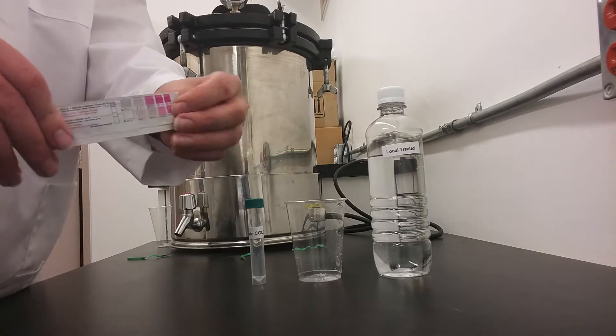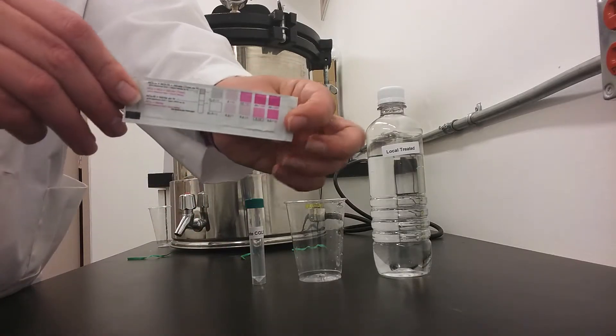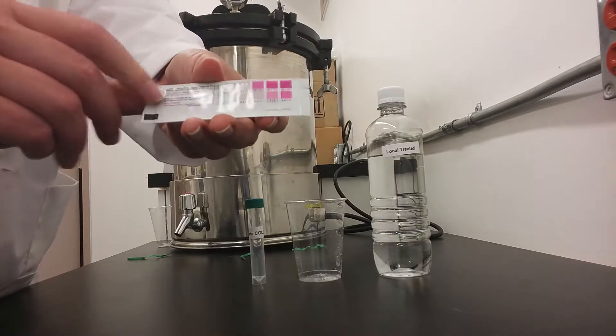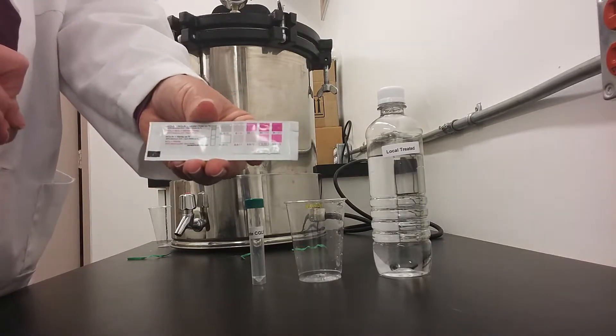We will also be using the nitrate test strips that come included in the water drop test kit. They have the color indicator on the back which you shall use.